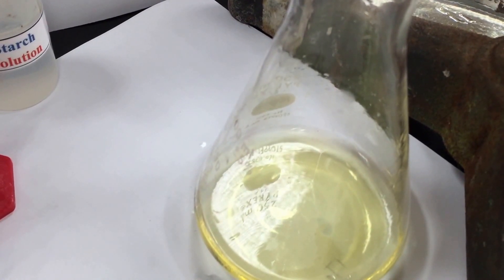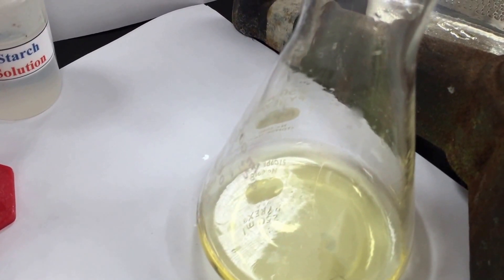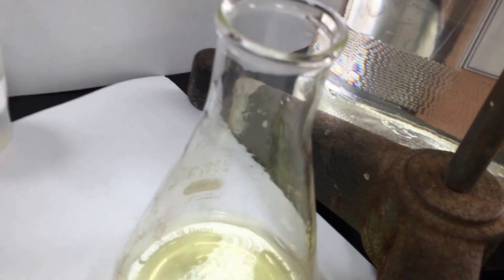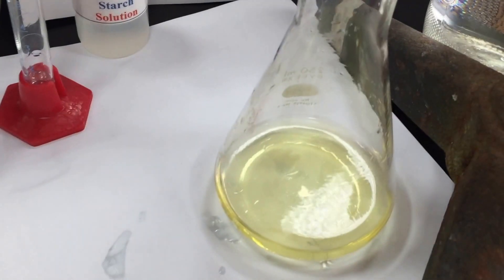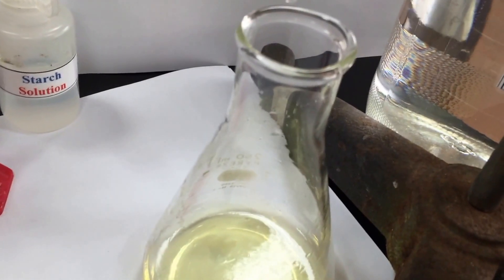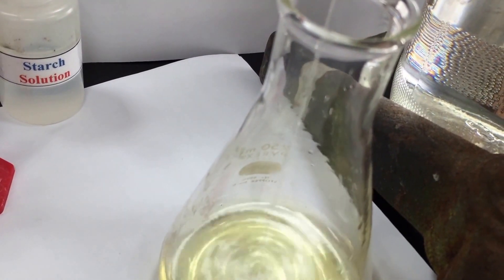23.45 down to 29.20. So that's a little bit less than 6. So I'm going to go for about 5.5 milliliters, and I wish I would have watched where I started. So 29.2. I want to go down to... All right, here we go.